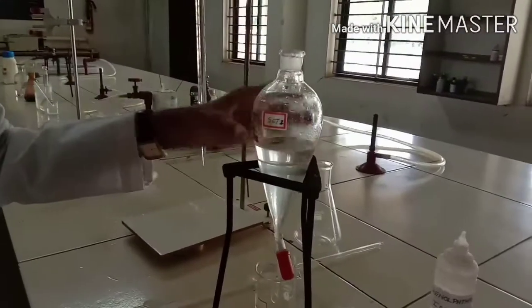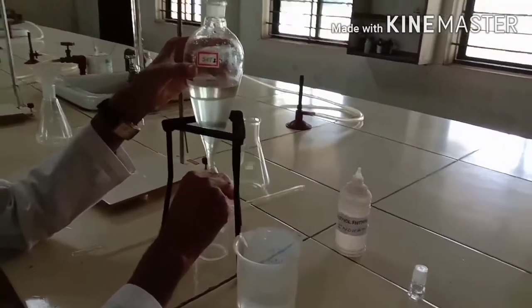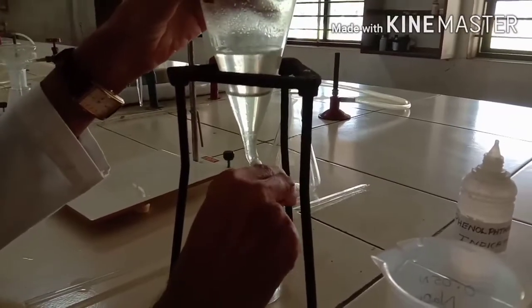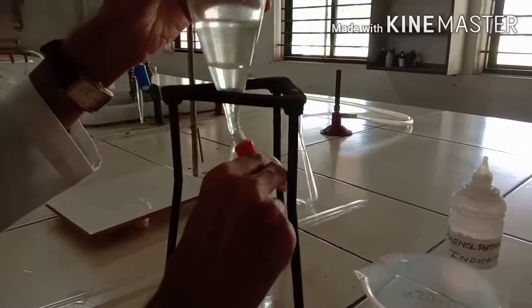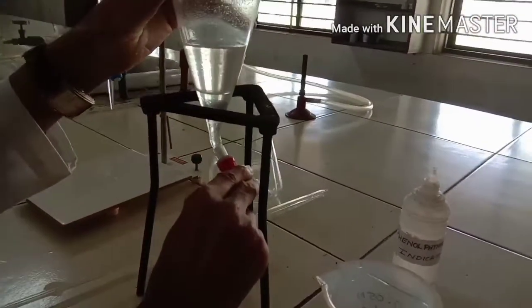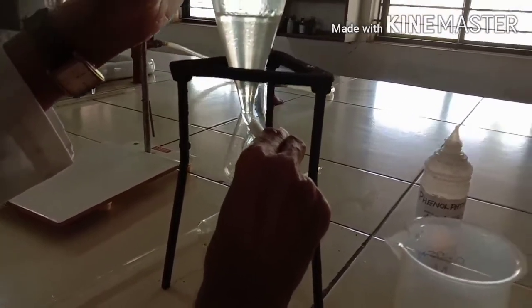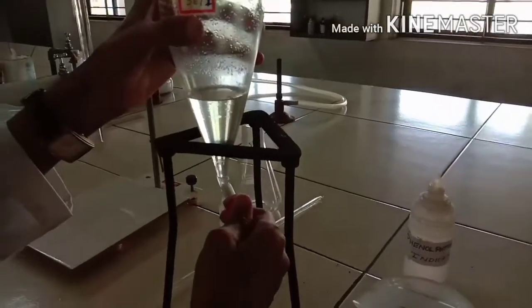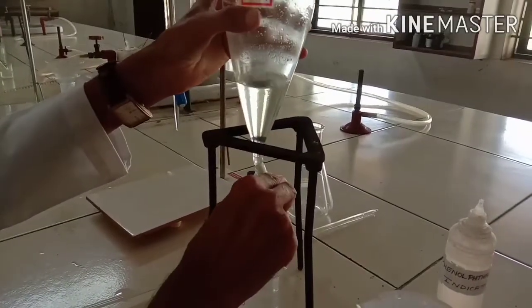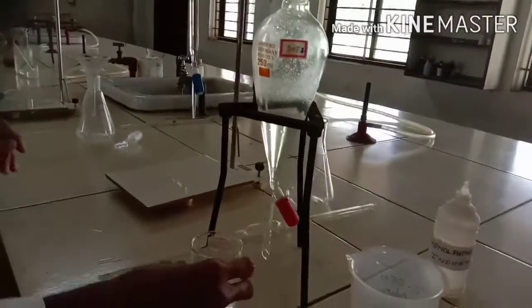To collect the aqueous layer, open the stopper of the separating funnel and slowly transfer the contents — only the aqueous layer — into a 100 ml beaker. Be careful while transferring; do it slowly, otherwise the entire contents will come out suddenly. Stop and tighten once done.